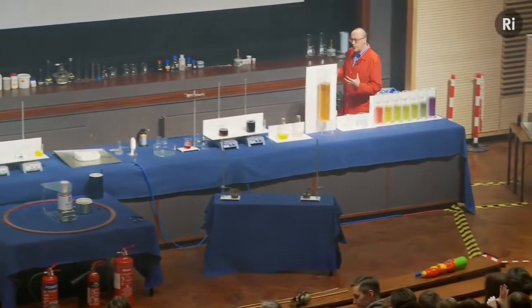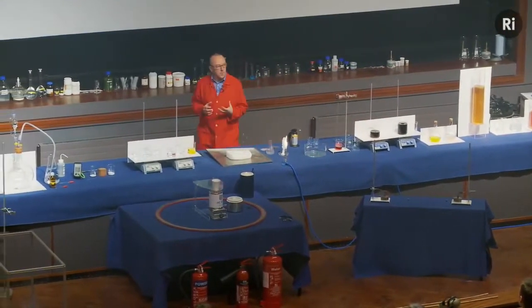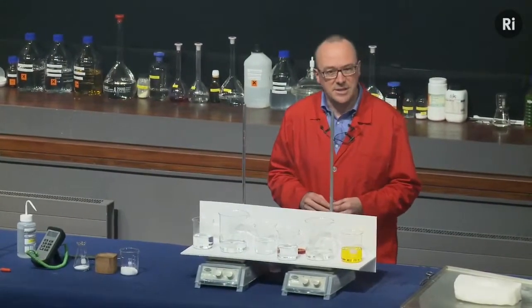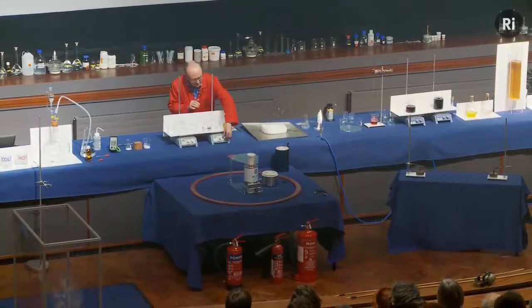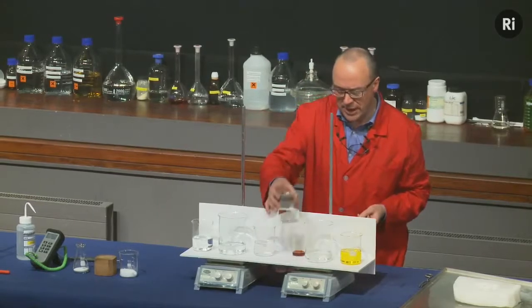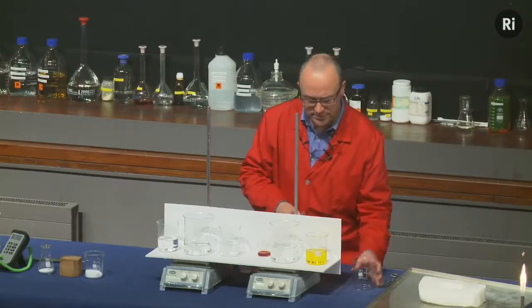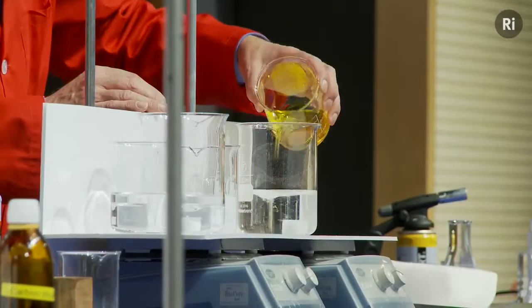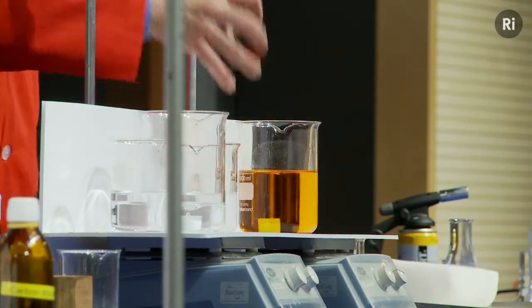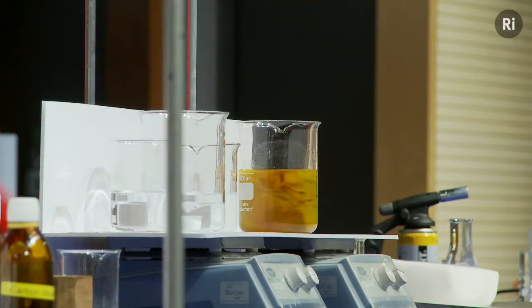So if you remember, one of the questions that we're asking in this lecture is whether a chemical reaction can go backwards. And I said this is a very interesting question. Well, let me show you a fascinating reaction. So in this beaker is a colourless liquid. I'm going to add a second colourless liquid. It remains colourless. I'm going to add some yellow liquid, and it turns orange. I'm going to add a little bit of red liquid, and it goes sort of green colour, kind of muddy colour.